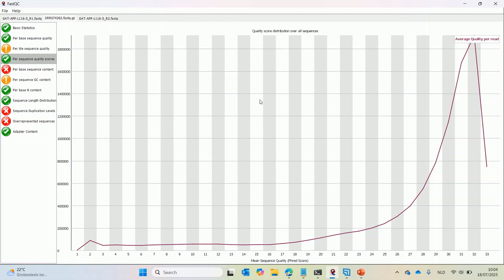This is the second plot in the FASTQC report that is related to quality scores, and it's very similar to the histogram that we saw in the basic FASTQ report. So it shows the quality of the reads. So I won't discuss it again. There is one feature here, this little bump that's typical for Illumina data that I will discuss.